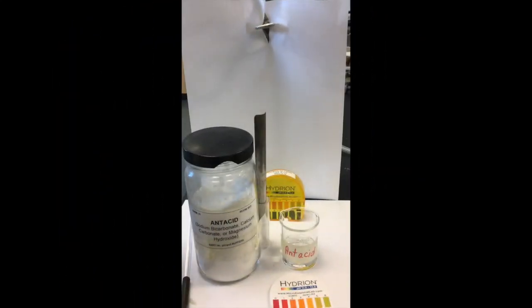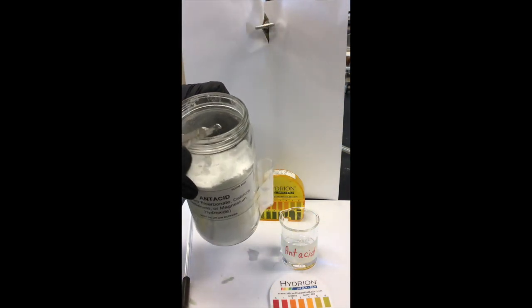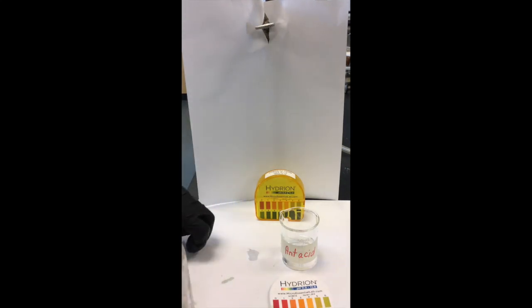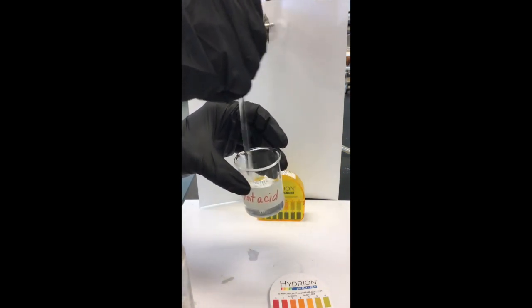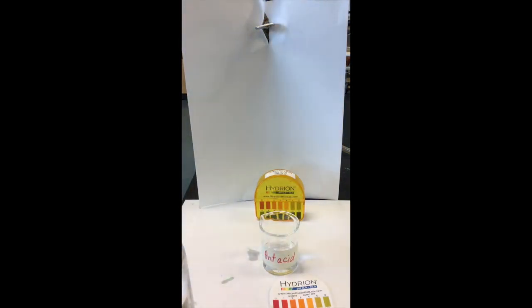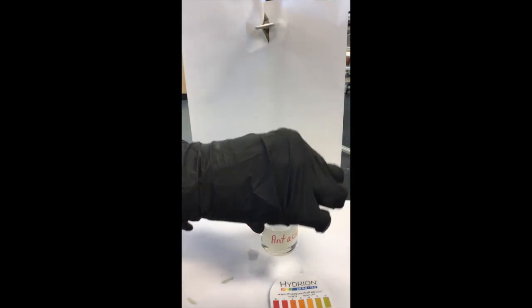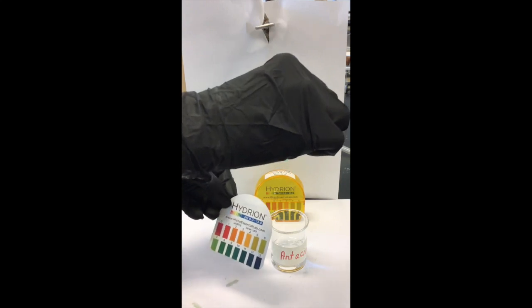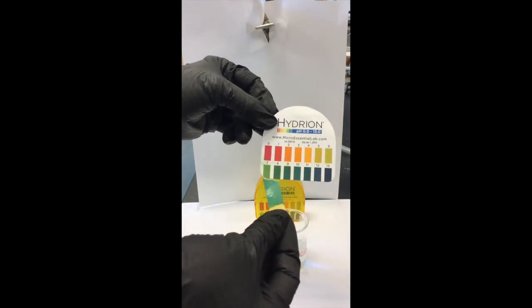The last solution we'll be determining the pH of is an antacid, which is also a solid, so we must dissolve it in water. An antacid is something you might take to neutralize your stomach acid — you have hydrochloric acid in your stomach used to digest food, and sometimes we take an antacid to counteract excess acid. Dip the pH paper in and compare to the color chart. Is it producing hydrogen or hydroxide ions — is it an acid or a base? Compare along the color chart to determine where this color matches best.